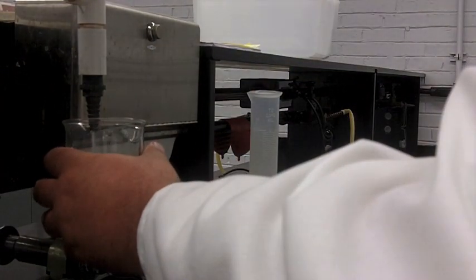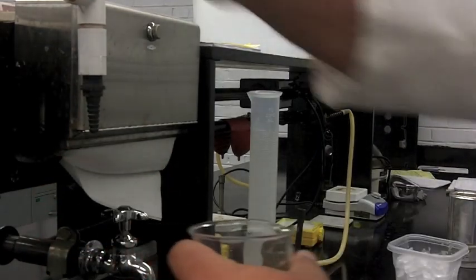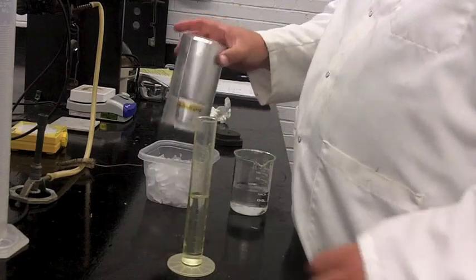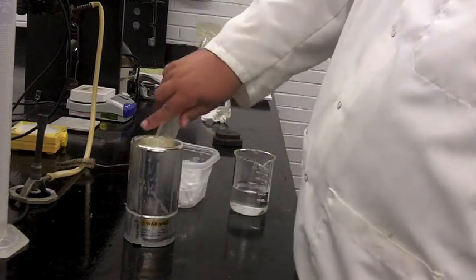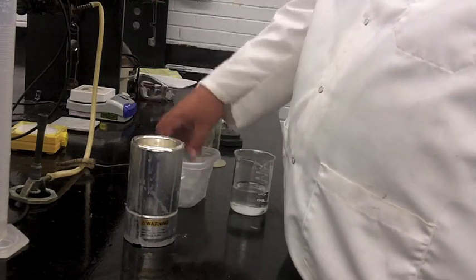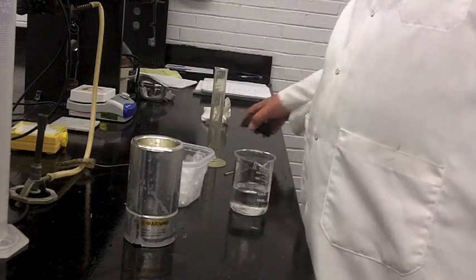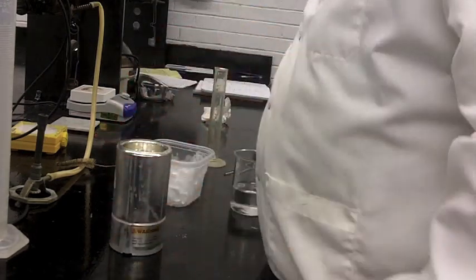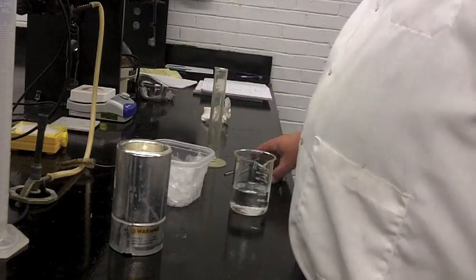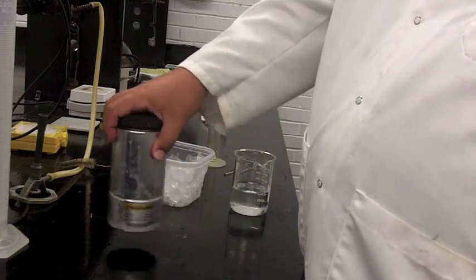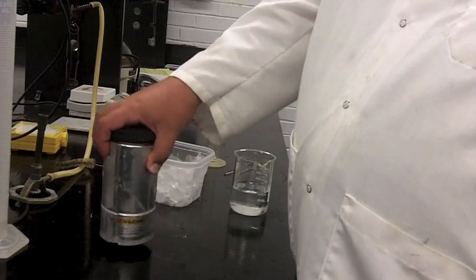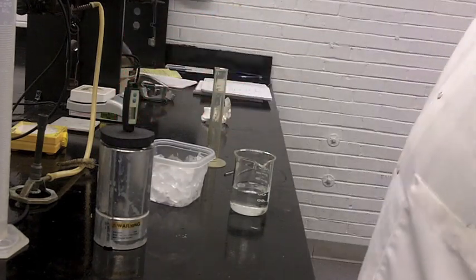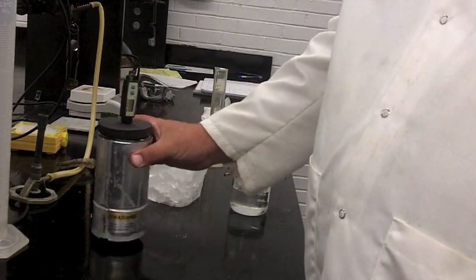The protocol is just as described in the lab manual. You'll take some DI water, doesn't really matter how much, probably 75 mLs or so. I went ahead and measured it; you don't have to. An approximate volume will be sufficient because we're really interested in masses here, not necessarily volumes. We're going to make an ice-water mixture. You'll chuck in some ice, swirl it and wait until it comes to a final resting point. Be very careful when you mix that you don't knock over the dewars. You may need to add more ice. This could take a while. We've got plenty of time, so just be patient. Eventually it will come to an equilibrium. At this point you can measure the temperature and get an idea about what the temperature is going to be. Hopefully this will match the freezing point of water. These thermometers are not calibrated, so it may not be perfect.